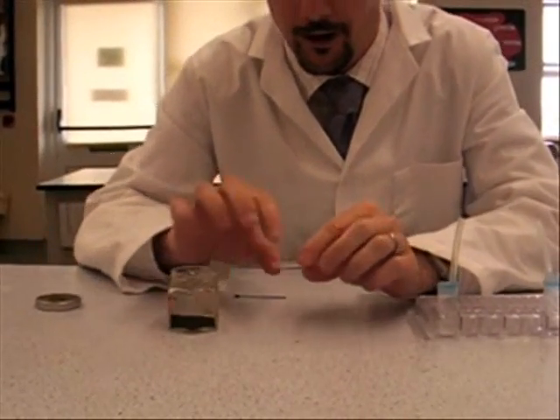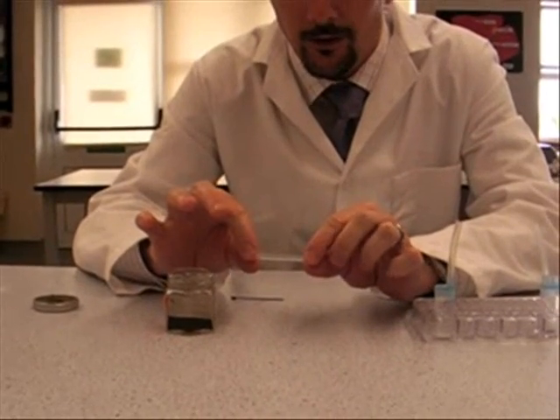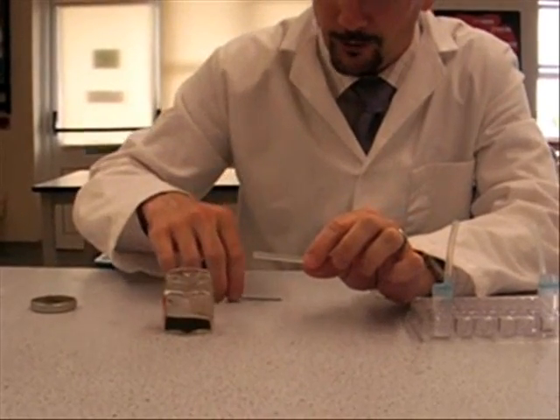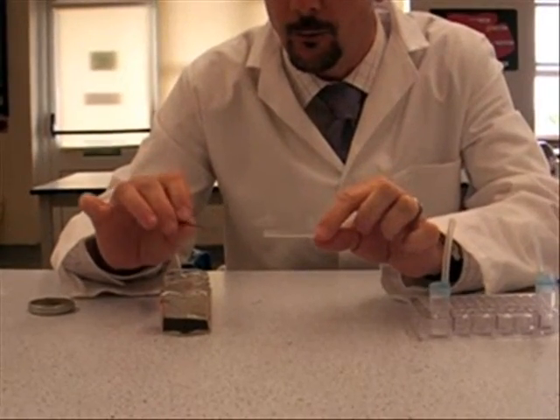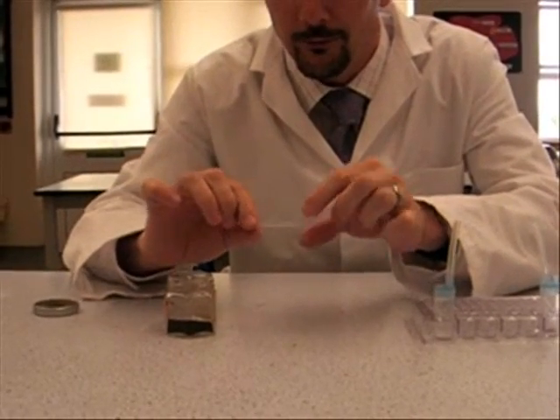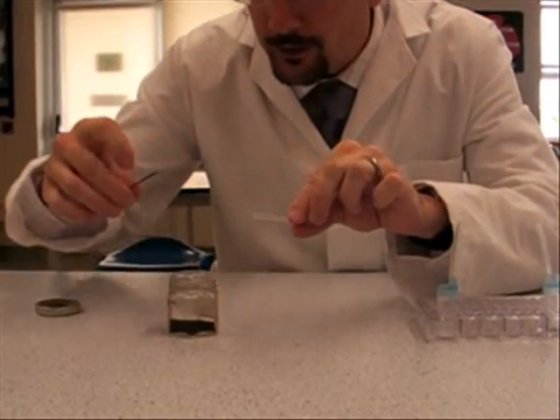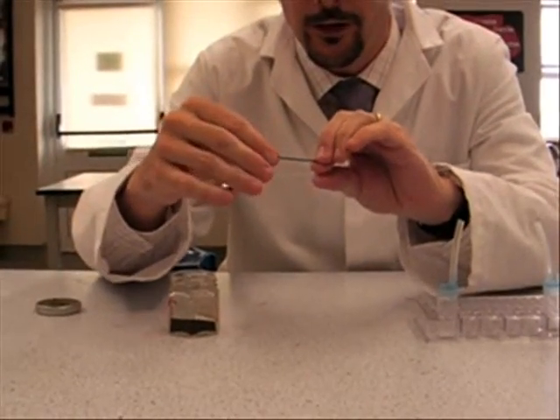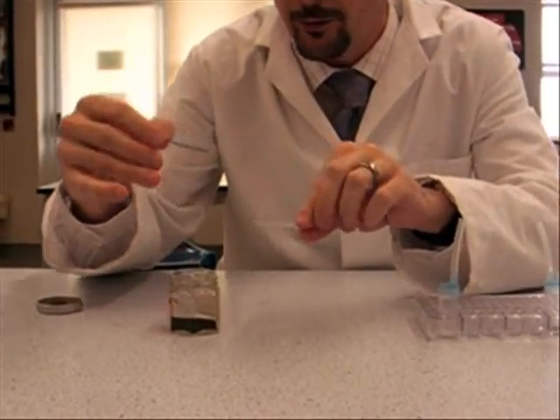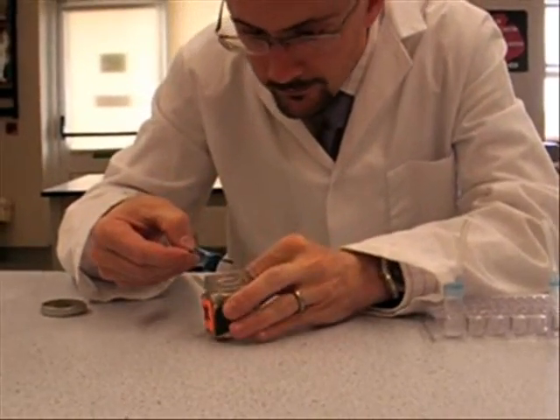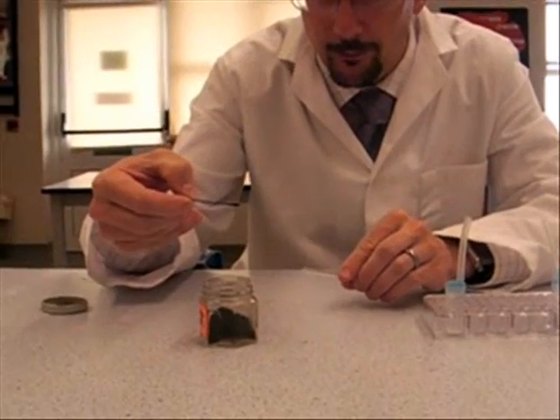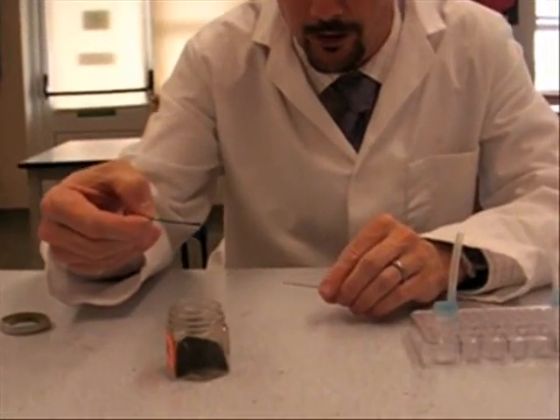And the copper oxide has got to be placed in here. Now the copper oxide, you need an absolutely tiny amount. Take the smallest amount you can think of and it's going to be even smaller than that. We're going to be judging you on how well you do this because this is one of the trickier bits.